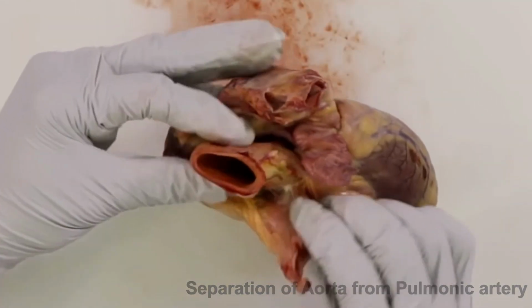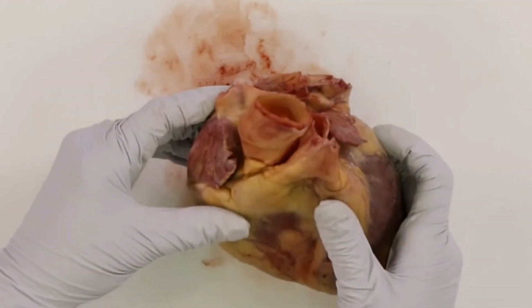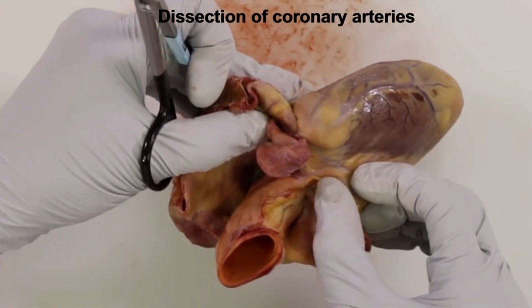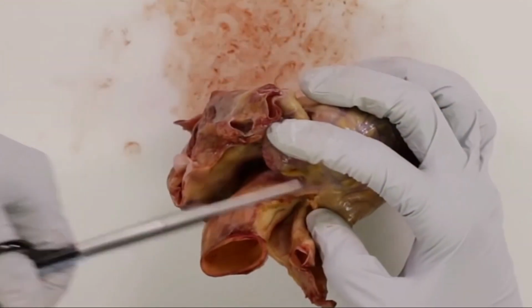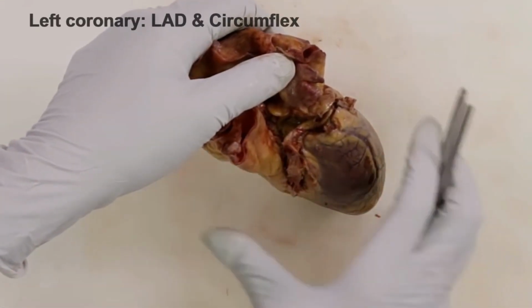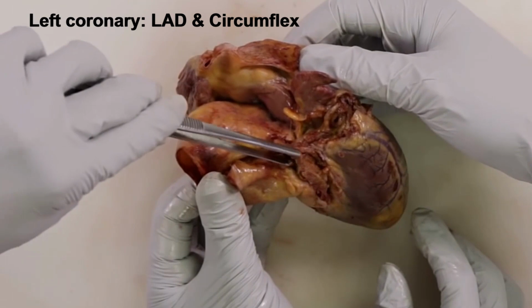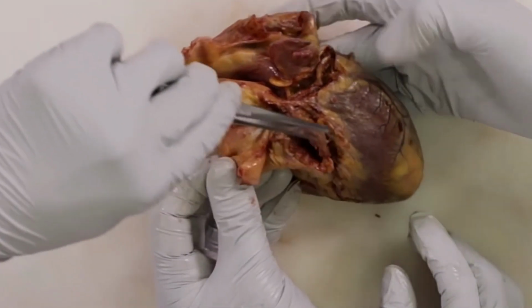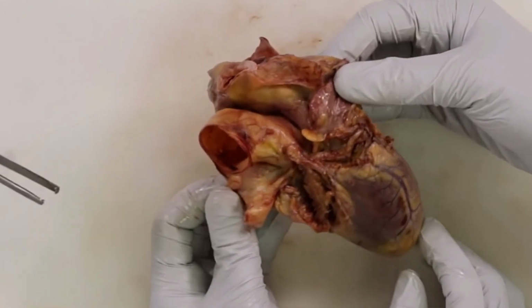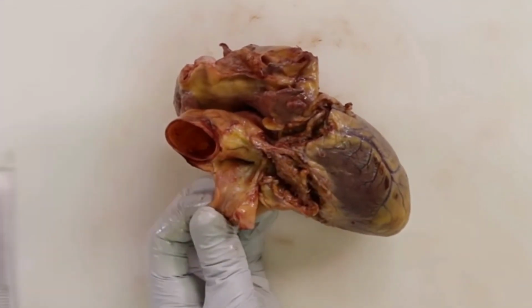So here we are seeing the separation of the aorta from the pulmonary artery, and this is an important part of the procedure to be able to make the dissection, starting from the coronary arteries first, and then be able to isolate them and make the dissection that we were talking about before. And then we are going to see the left coronary artery and the circumflex, which are already partially dissected, and they are showing the circumflex, and they're going to proceed to remove it.